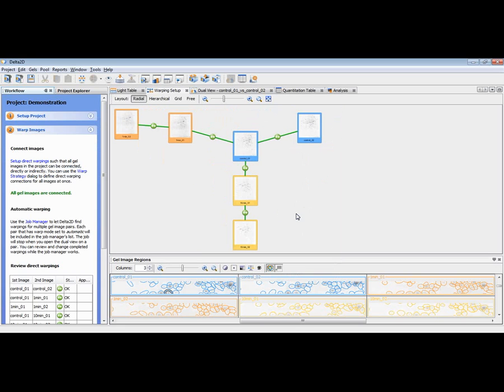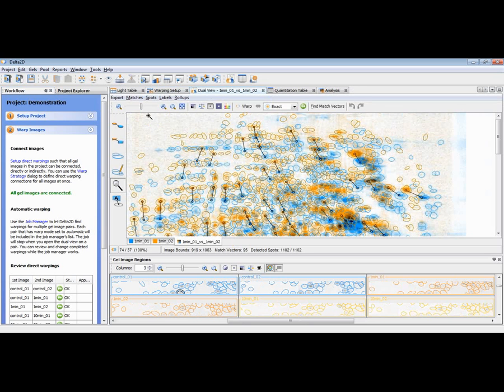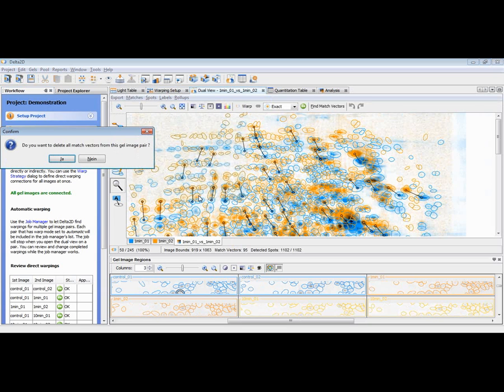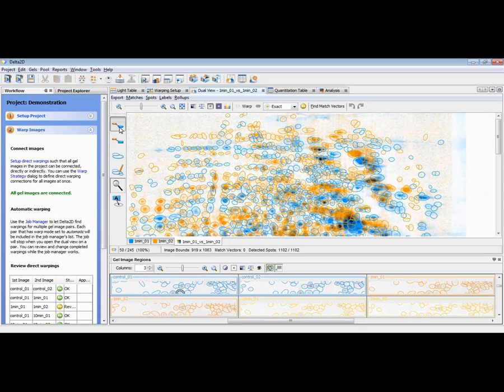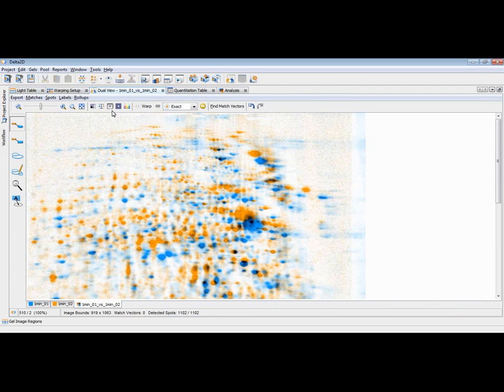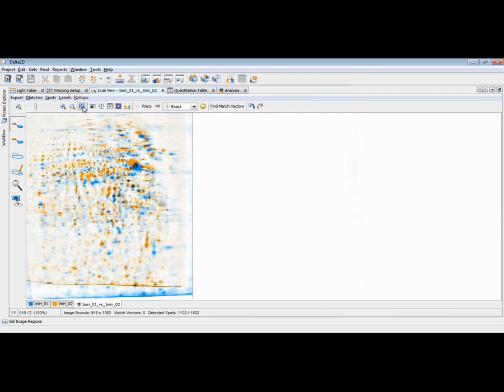Then coming to the different warpings themselves, we should open a certain transformation which is not yet done, at least if you are starting with that. I would first have to delete all these match vectors because they are not yet available. Now we have the raw images. They are there. Let me increase the size of this image and zoom out a little bit.